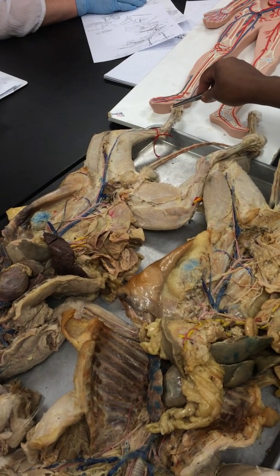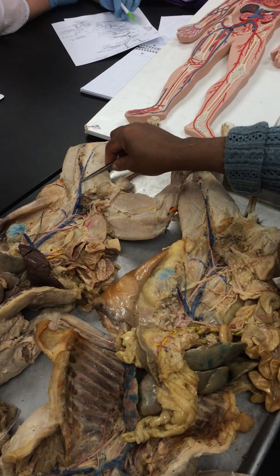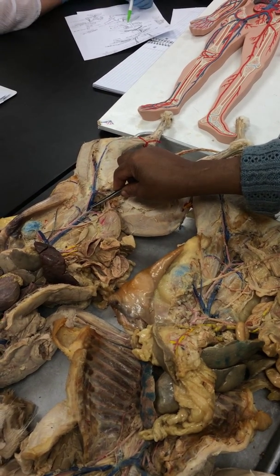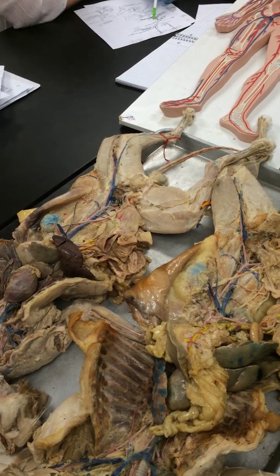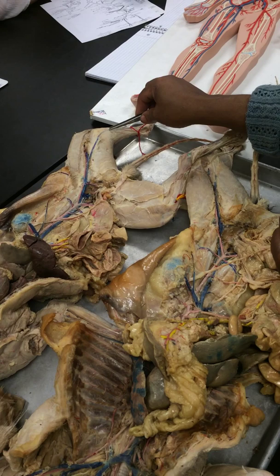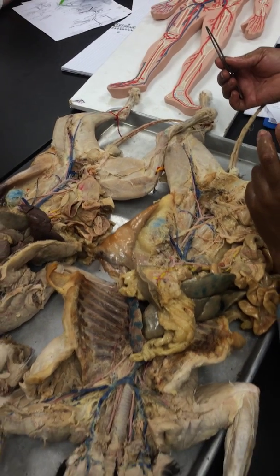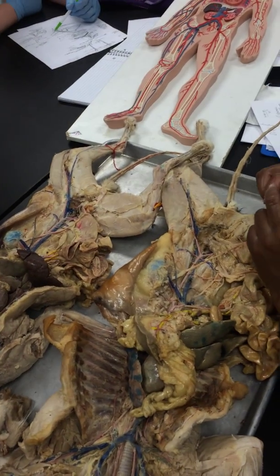Now if I wanted to come from my toe, I can take greater saphenous vein, and it empties into the femoral vein. The femoral empties into the external iliac. The external iliac empties into the common iliac. The common iliac empties into the inferior vena cava, which then takes me to the heart. I could also come from my toe, come up the greater saphenous, and then I'd meet popliteal, and then I could come through the knee. But that would be going out of my way, because the popliteal does come back and join with the saphenous.